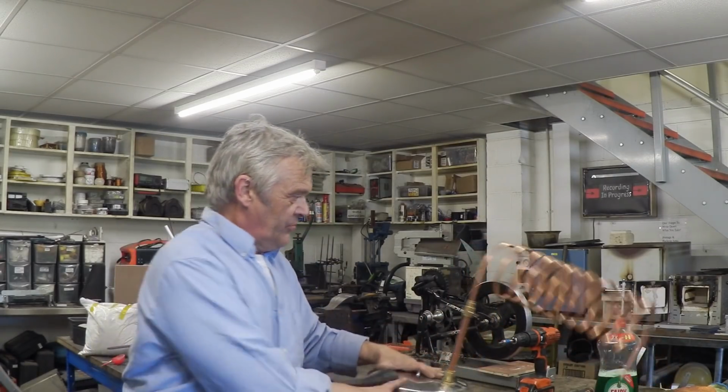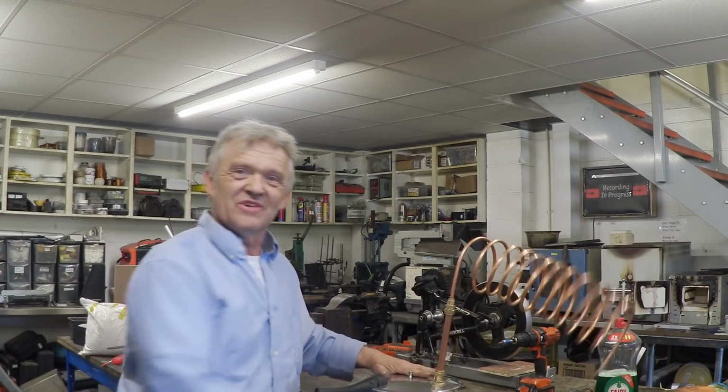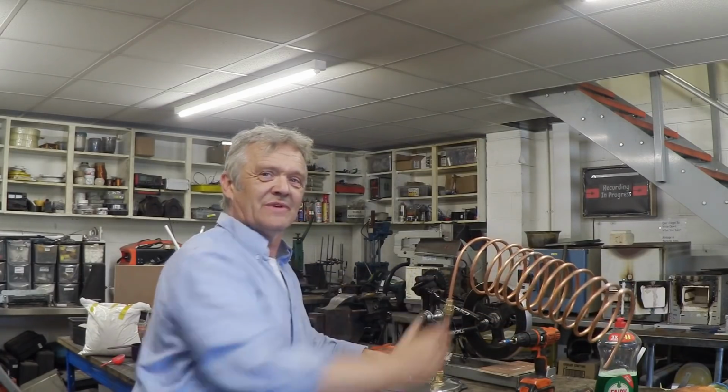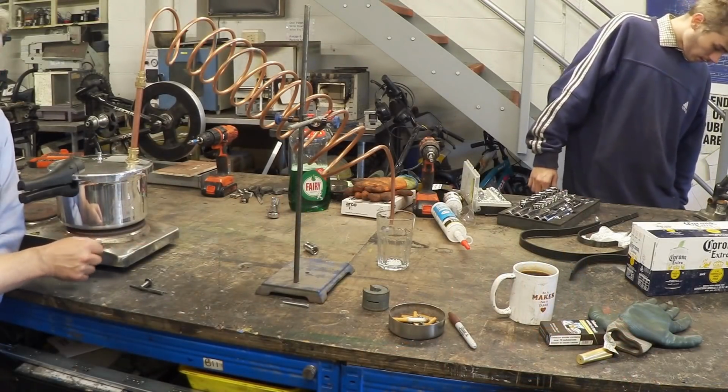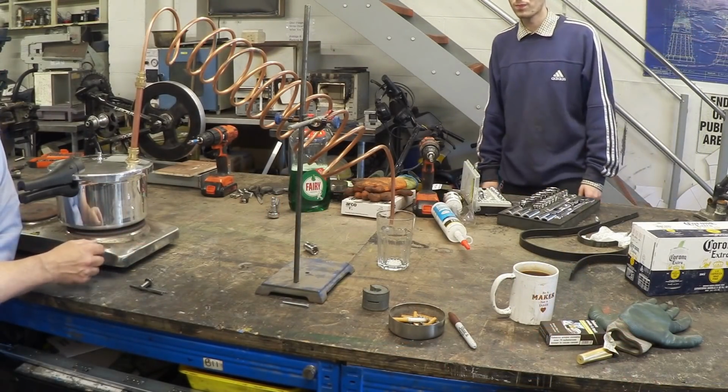I mean, it really is quite easy. What we're talking about, 5 minutes or so, and the expenditure on this, this, and this. Now, obviously, that's a bit wobbly, as you just saw. There we go. So we need a stand to hold that. So we'll grab a stand in a minute, and then we'll finish that little bit just by tightening those nuts up. So there it is, purely for educational research purposes only, our distillation equipment.